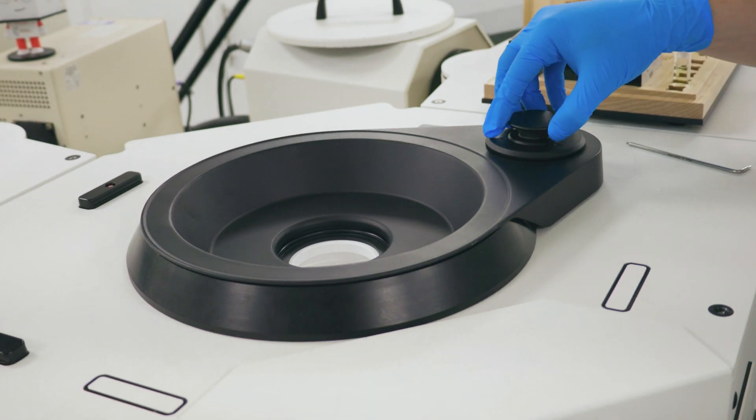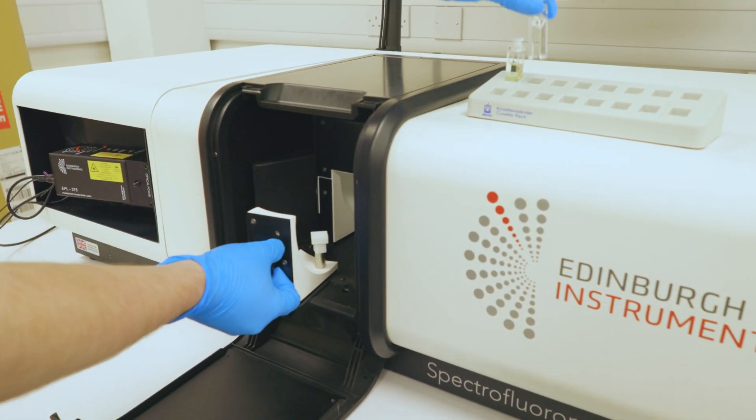The first step is to determine the absorbance of the stock solution at your chosen excitation wavelength.